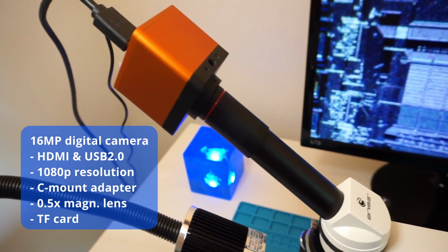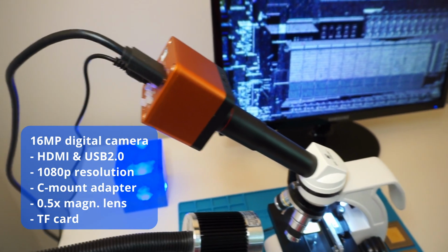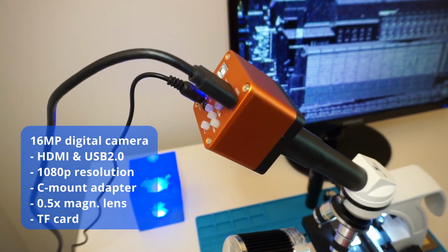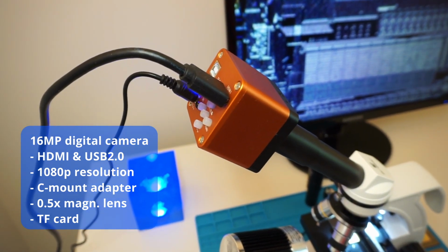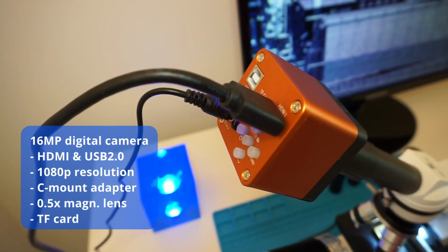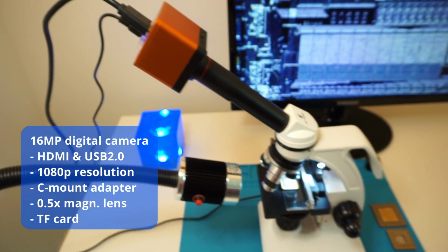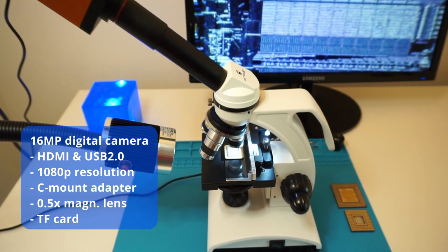There's an adapter, a C-mount adapter, which I use here, and it has a lot of functions. I can also have a direct image out through HDMI. I have a direct connector to the PC and I can take nice pictures.